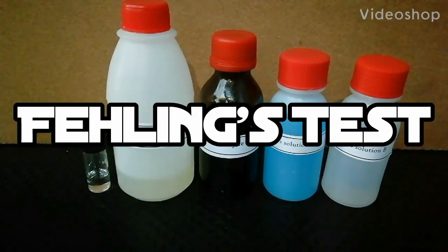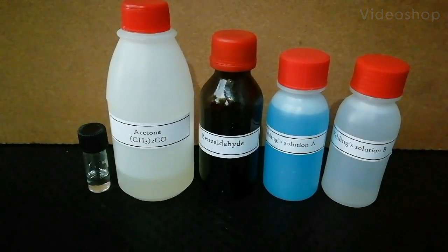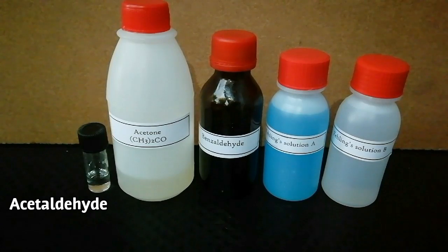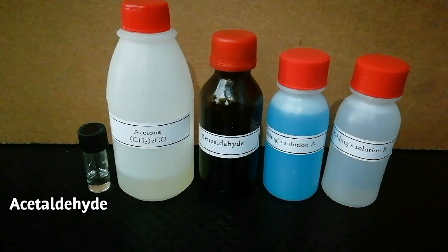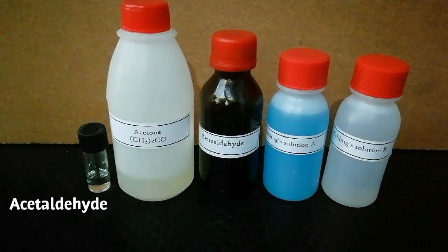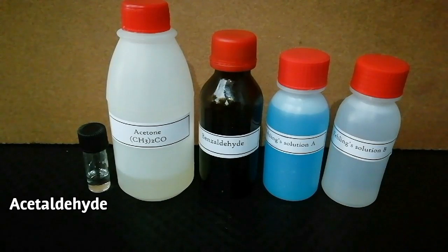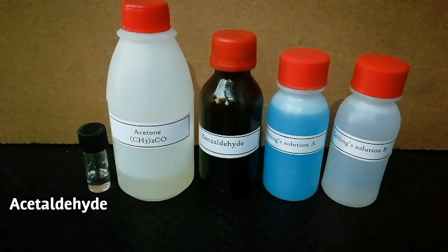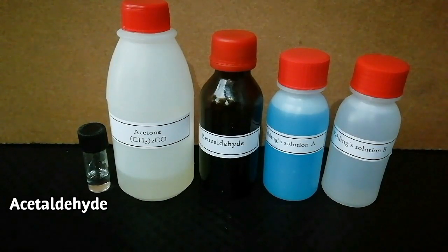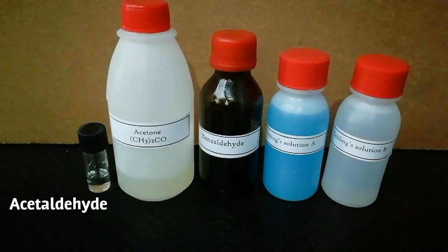Fehling's test for aldehydes and ketones. In a previous video I showed you how to prepare Fehling's reagent. In this video I use it to identify aldehydes.